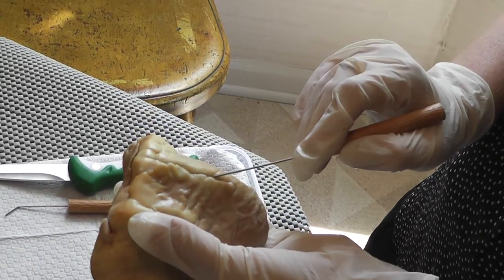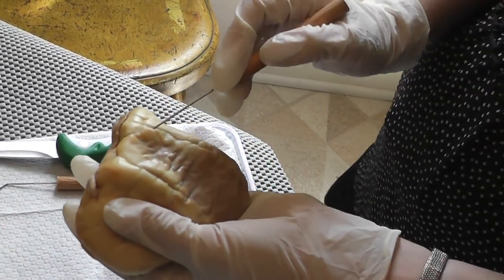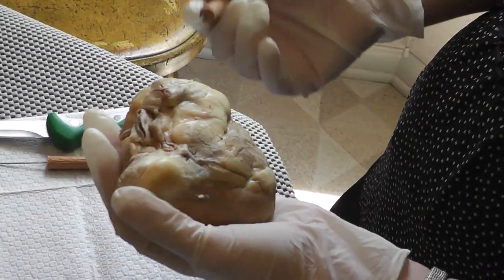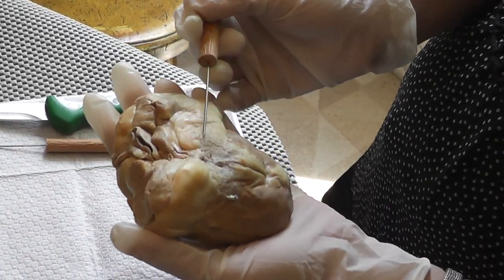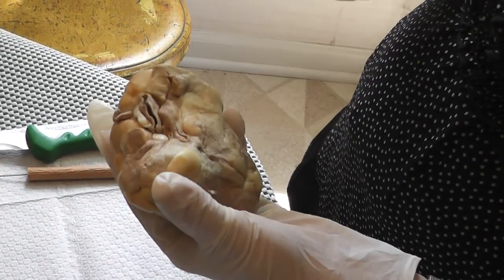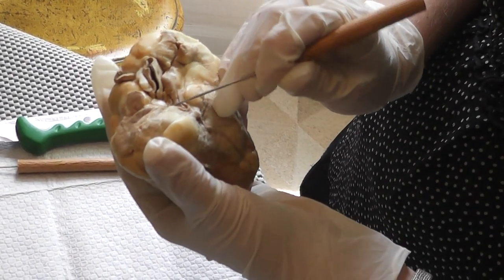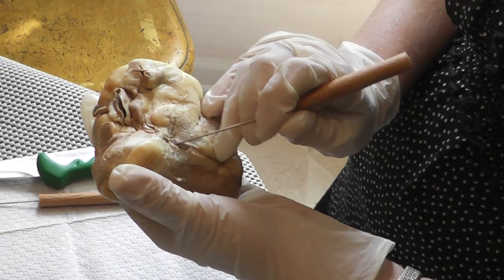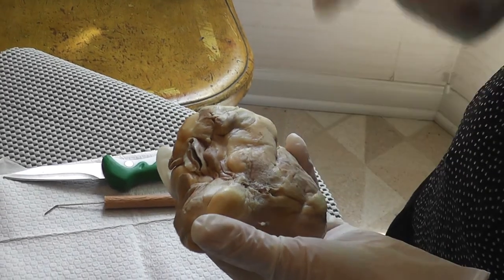There's another sulcus over here, which is called the interventricular sulcus, and because this is the anterior part of the heart, the anterior interventricular artery goes through it. If I look at the posterior of the heart, there's a coronary sulcus that goes through here, and the circumflex artery runs in it. In the posterior of the heart, there's the aorta again, you can see it. The superior vena cava is right over here. It's posterior to the aorta, and then it turns into the inferior vena cava, and it exits over here close to the coronary sinus, which is located right here.